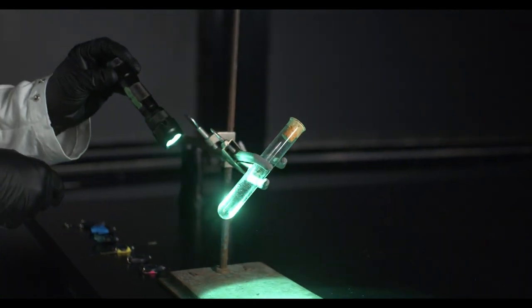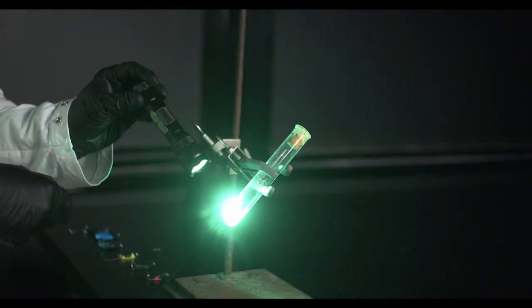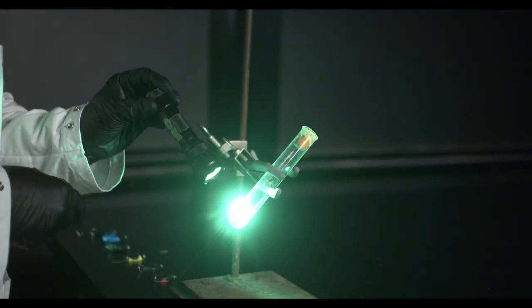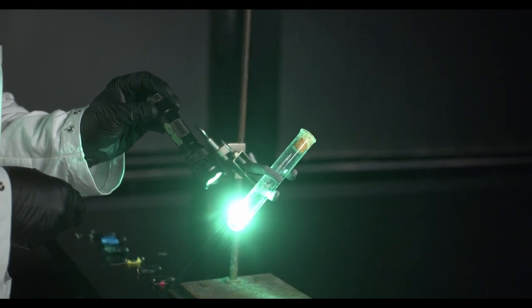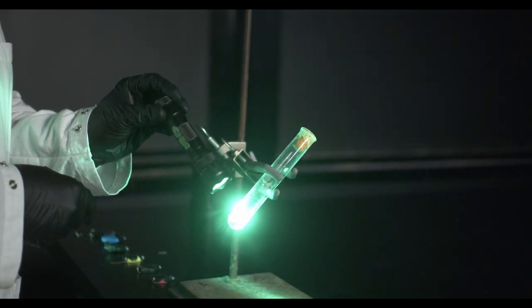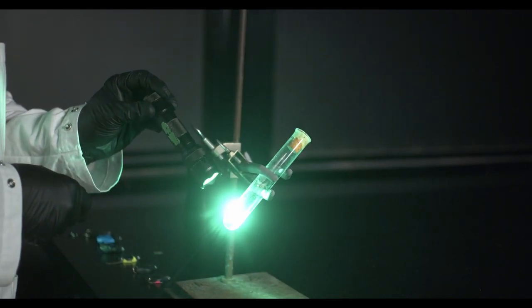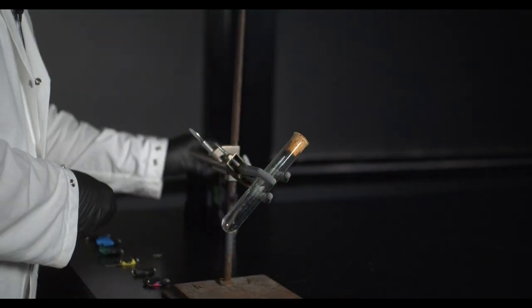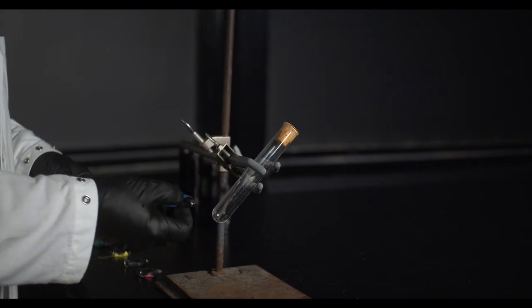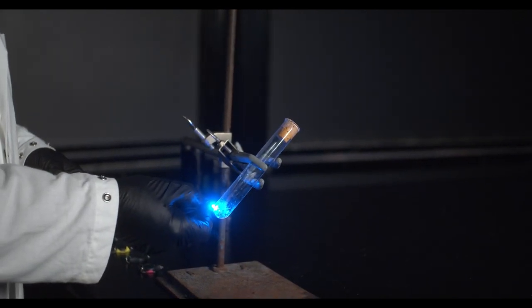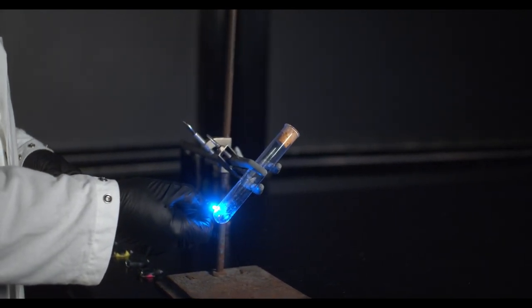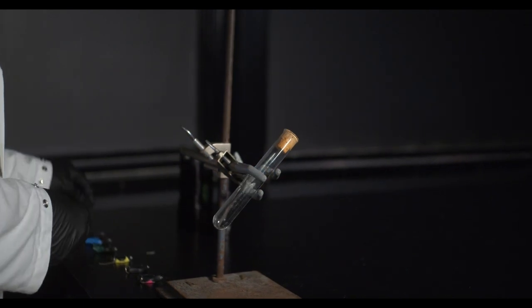We have a flashlight with the green LED. So we're dumping a huge amount of energy in the form of green photons and we're still getting no reaction. Now, moving to blue light. No reaction.